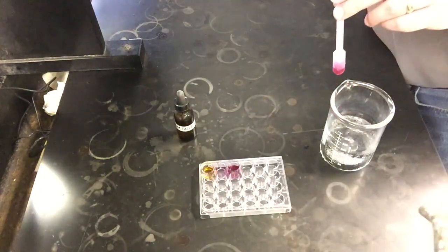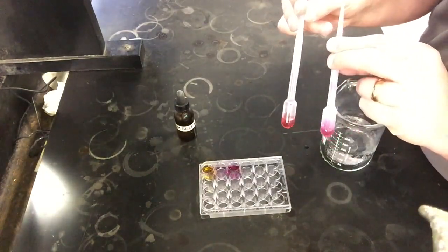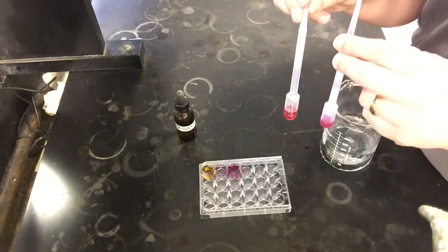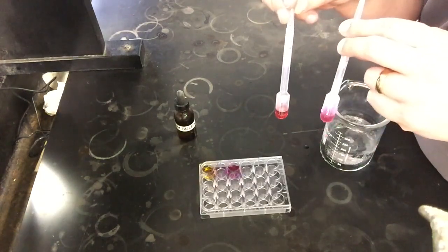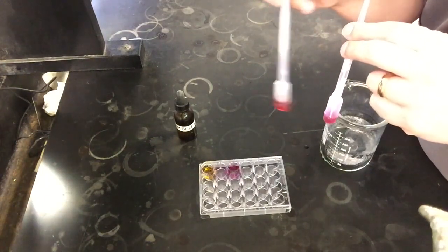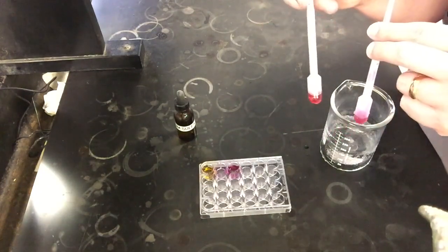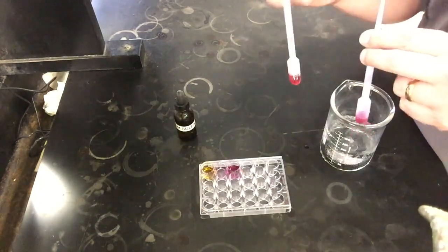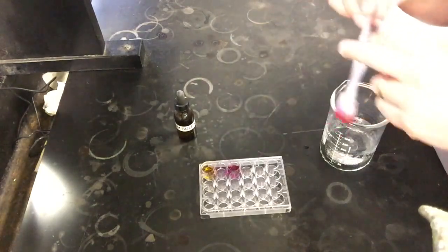And just to give a good contrast, I actually went ahead and made some more and put it in the hot bath so we can have a color comparison here. It's not a huge color difference as we're looking at them, as I'm trying to spin these at different angles for our camera to see. But this one that I'm holding here is hotter. This one was colder. The hot one is lighter in color. It's a little more reddish orange as opposed to purple red. So the lighter color is tending towards the reactant side. That means adding heat did make this reaction go towards the reactant side of our reaction. And we can use that in our observations and conclusions later.